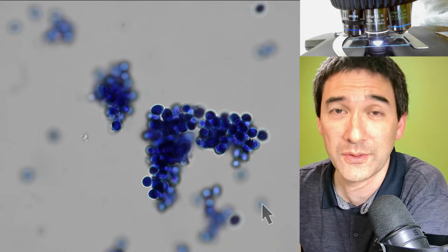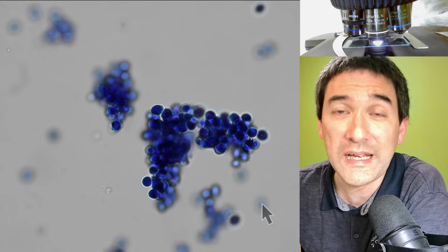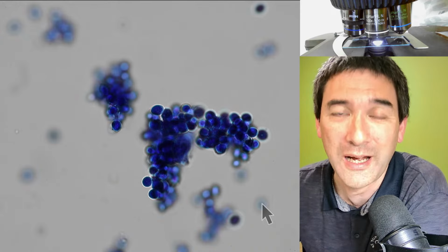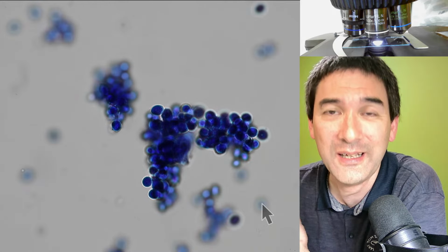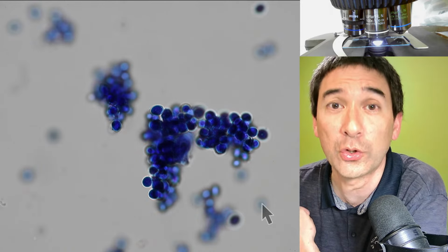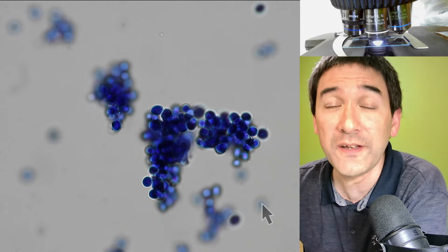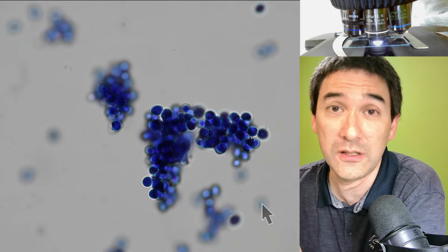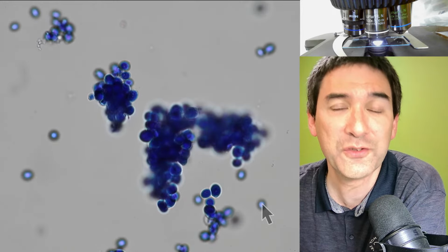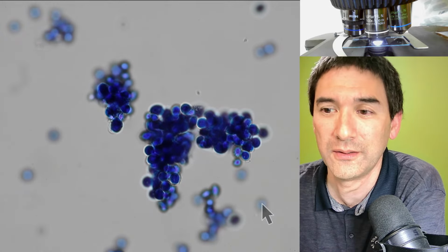This is a little bit like if you put an egg into a frying pan, then it's going to be fried, but it still looks fine. But if you leave it too long or make it too hot, the molecules are going to start to break down, and this is when it starts to burn, and that's something that you should not do. But heat fixing will actually kill the cells because of the heat, at least those cells that have survived the drying process, because not all cells survive the drying process as well.